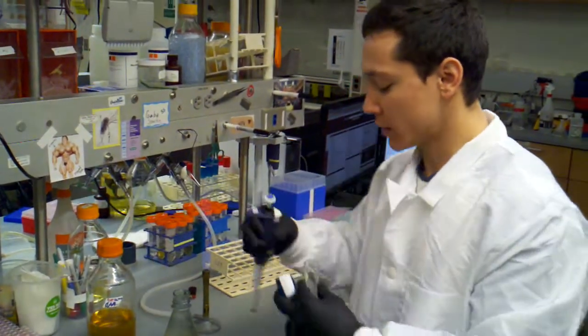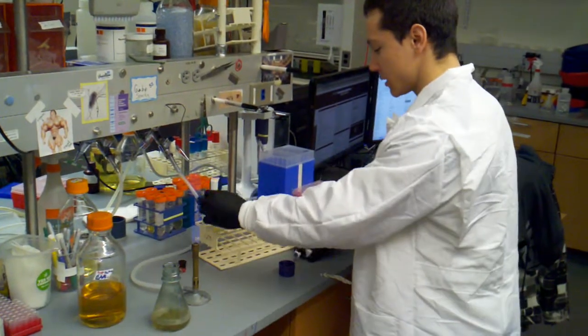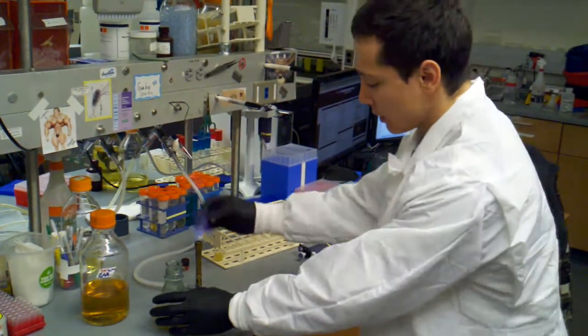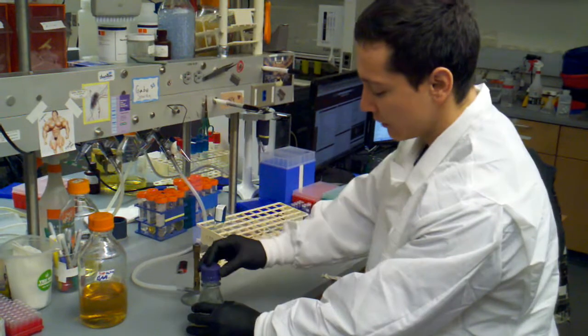2, easy to tip. Got this. We're done with that for now. Pull everything off. Cap it.